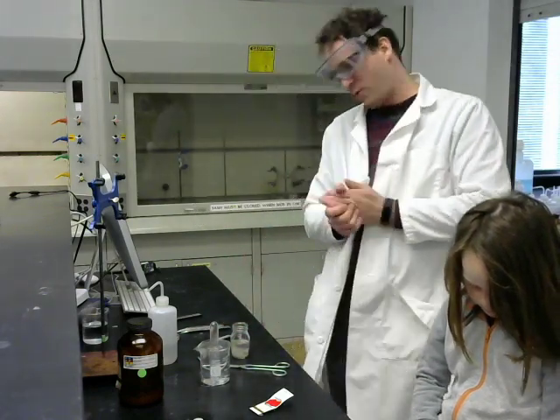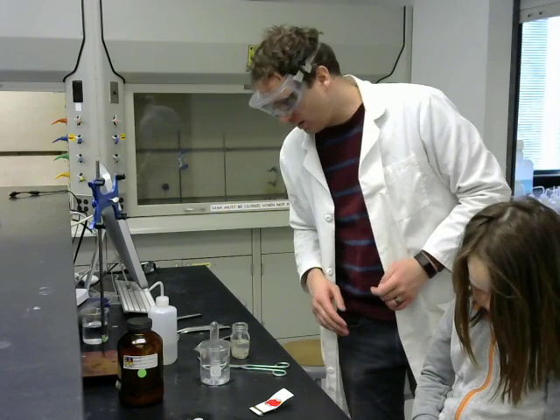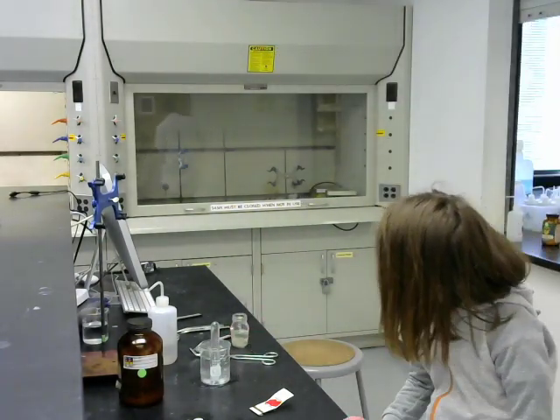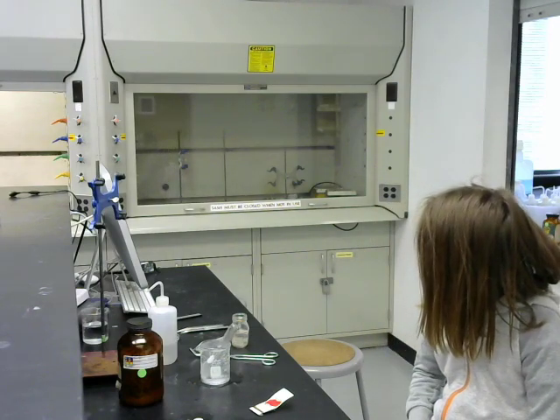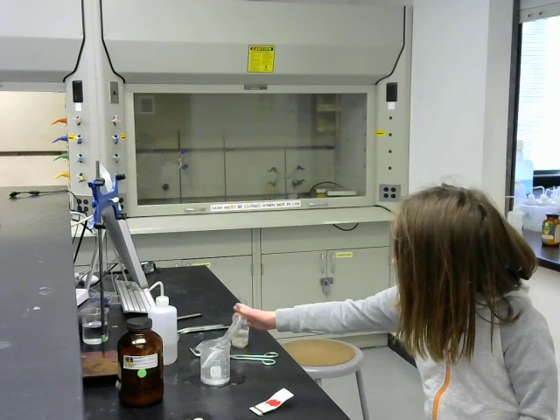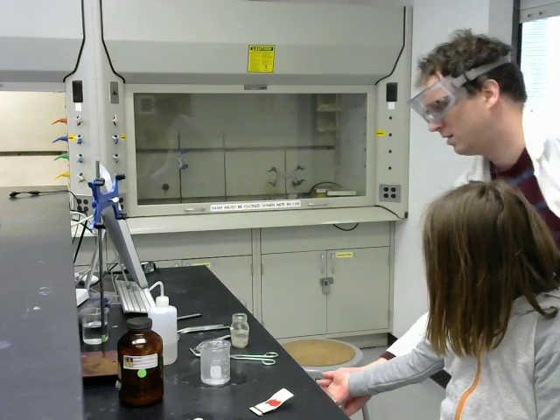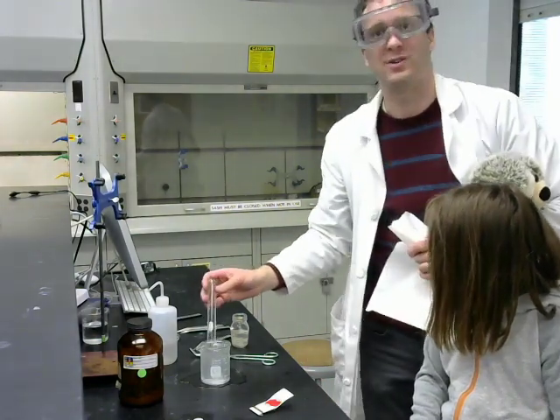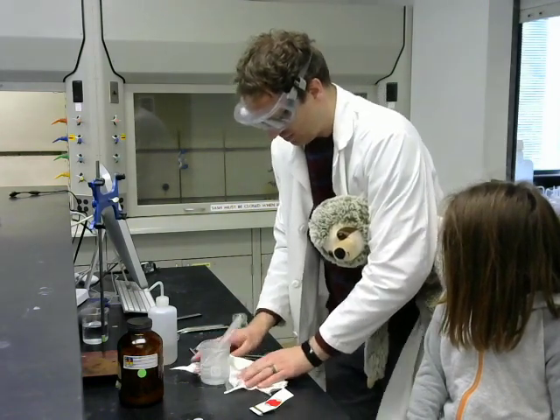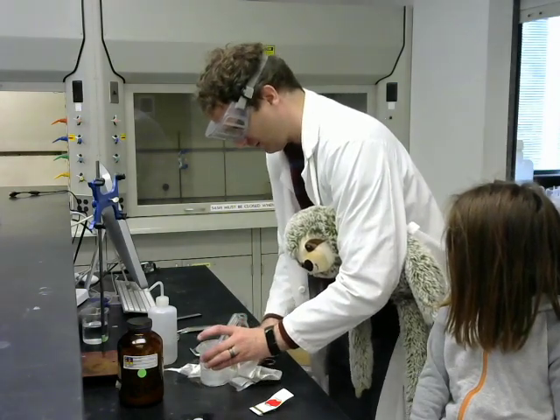You know, with four big old calcium chips, it actually is bubbling rather vigorously. And I'm overflowing my beaker, so I'm going to go grab some paper towels. Daddy, your test tube. Honey. I guess we'll have to redo that one. Was it floating up? Yeah, so I tried to put it down, but then it fell out. Thank you, hon.